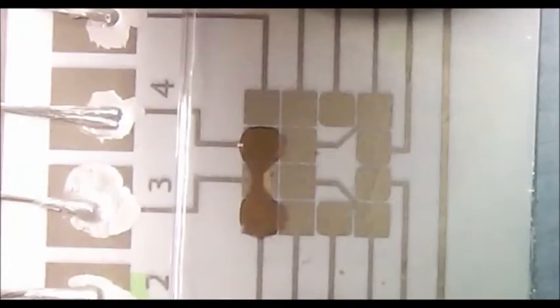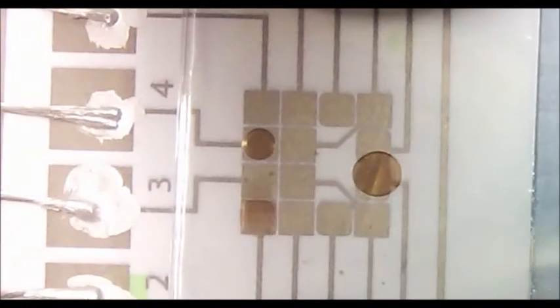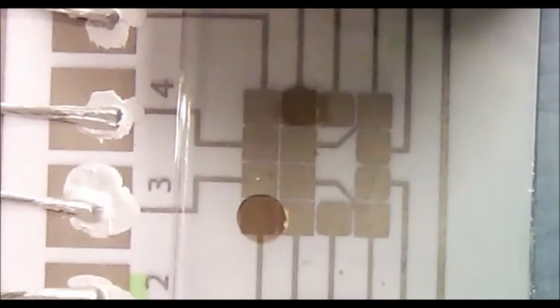Test how fast the splitting routine can work. It's now twice as fast. That's fast. No. No. No. No. This is 25 milliseconds per electrode actuation. It's insane.